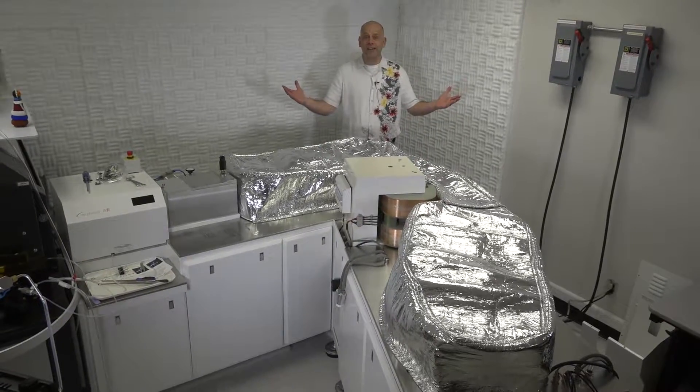12 hours later, the bake-out is done. We're going to reassemble the instrument in reverse order, just as the manual states.